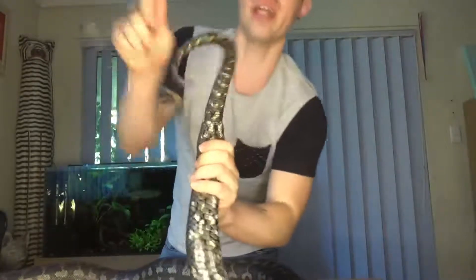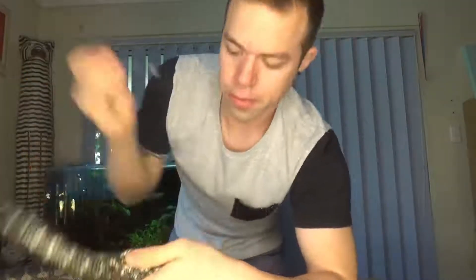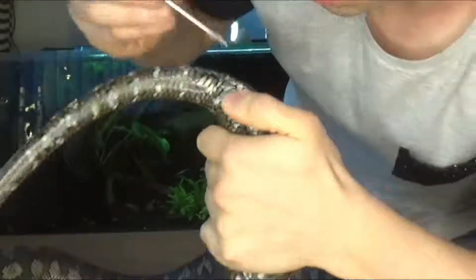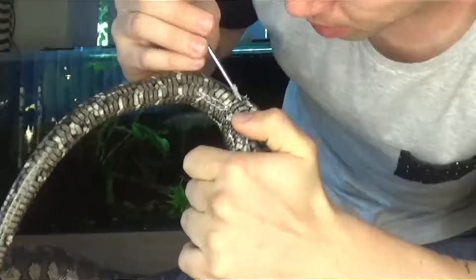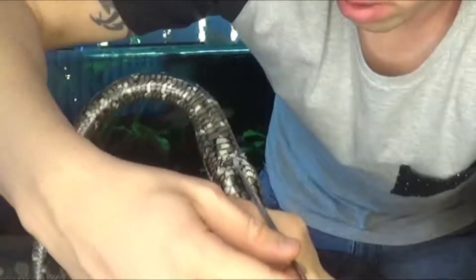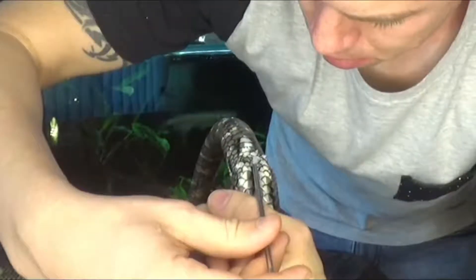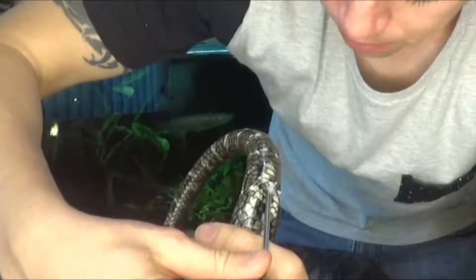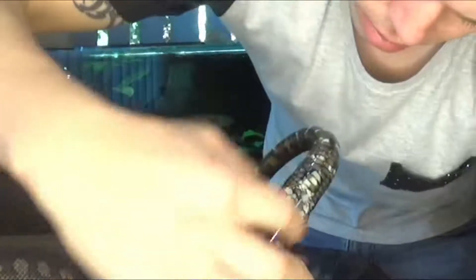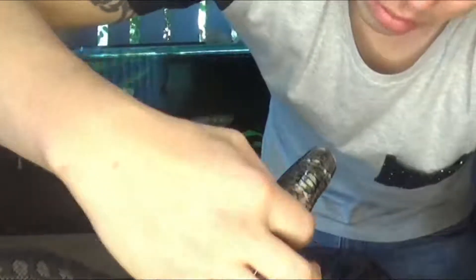Normally this is a two-person job for a snake this size. So you want to get your probe into one corner of the cloaca, whichever corner that may be. First you want to probe under the flap, get it onto the flap, turn it around and gently just work it in like so. See, that's going in nice and slow. Be careful not to do any serious damage - nice and slowly. And that's about as far as it's going without applying too much force - that's his limit.